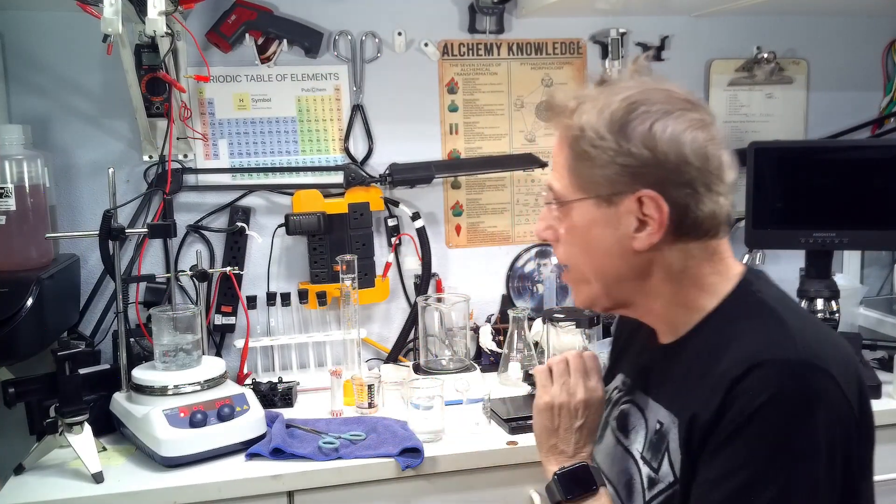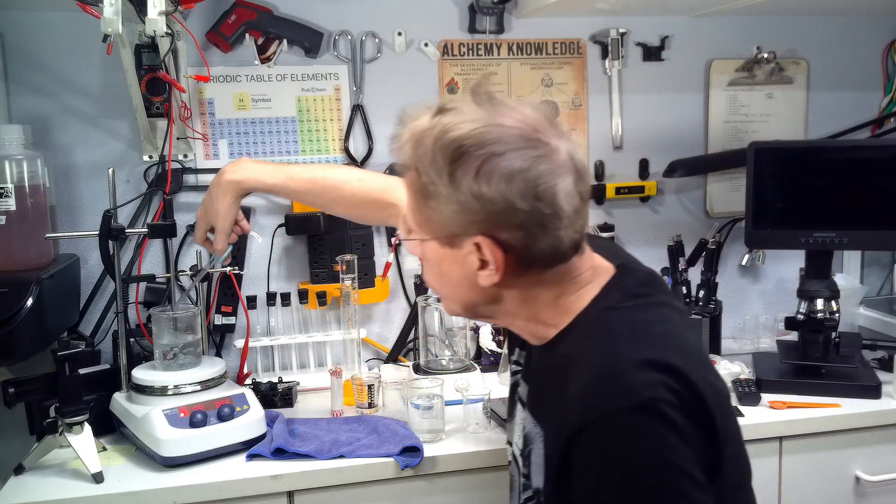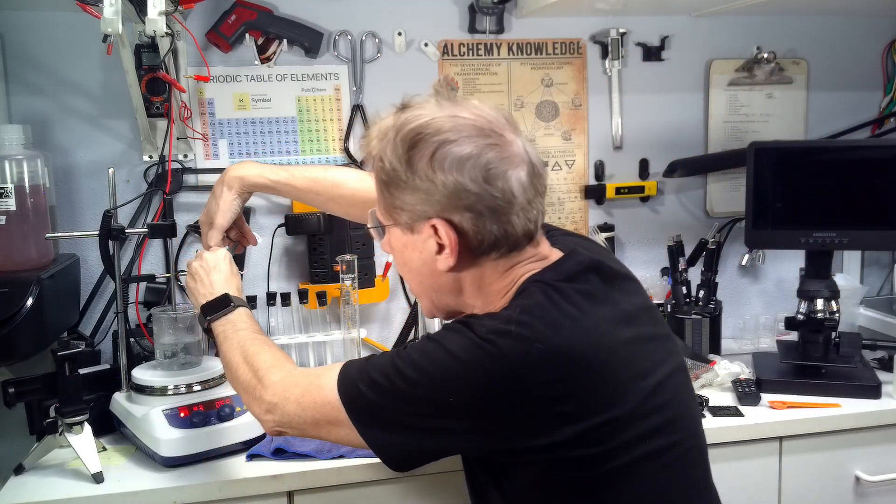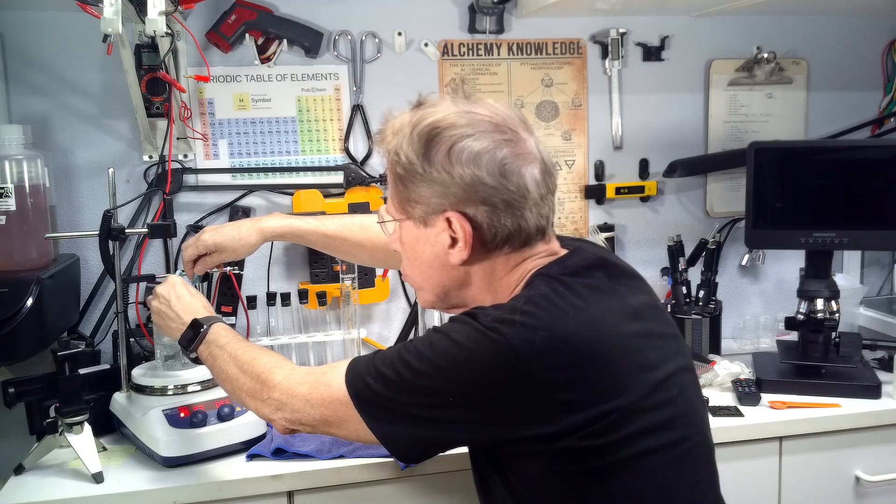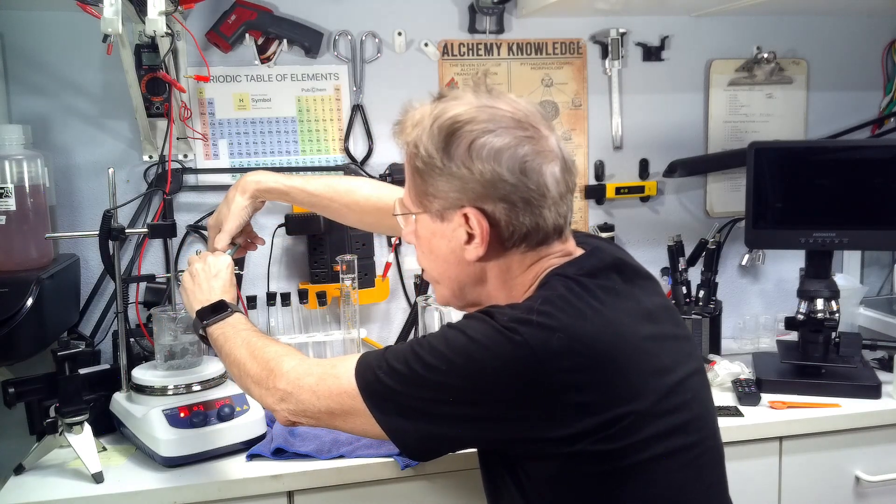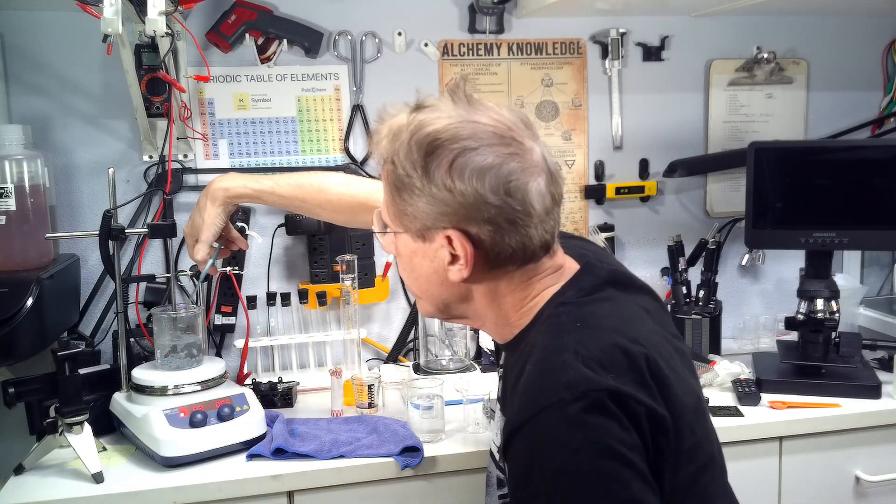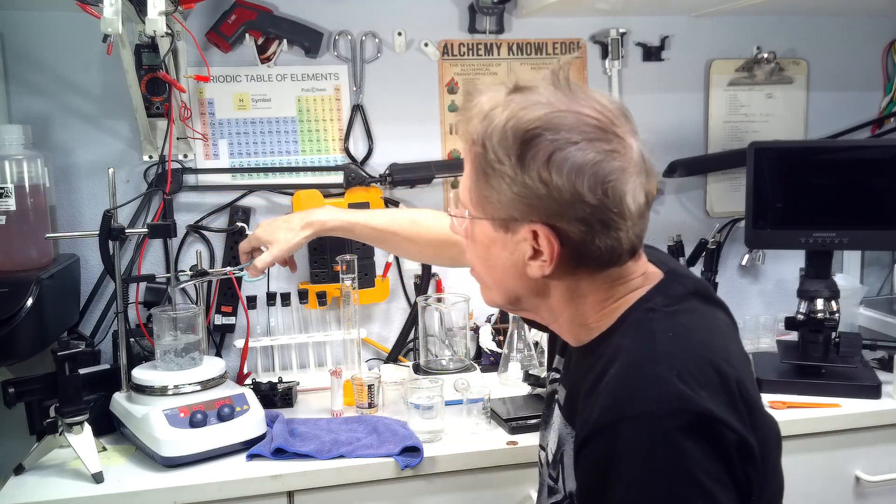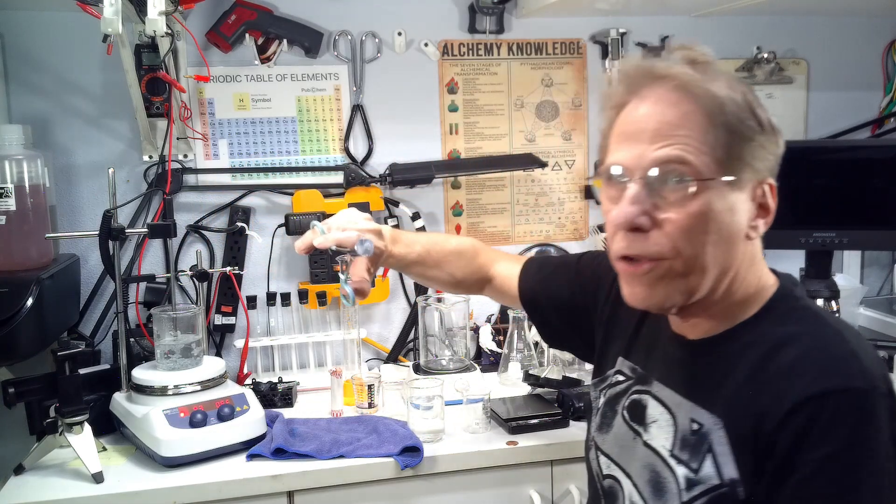All right. It's been about five minutes and I think our penny is ready. So you don't want to put your finger in here. A, it's hot. B, you do not want to touch the solution. Not good for you. So we're going to take a zinc coated penny out and look at that, huh? It's absolutely silver.